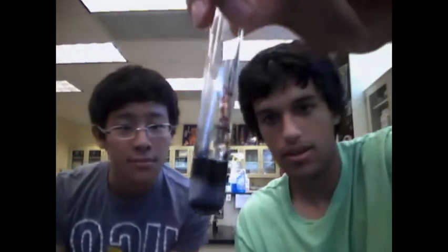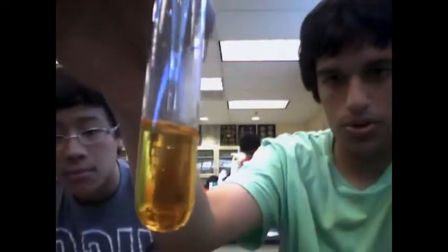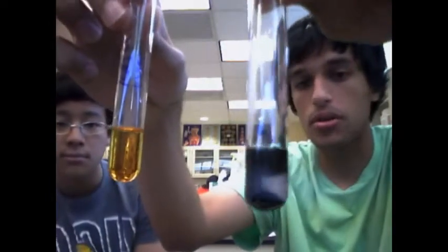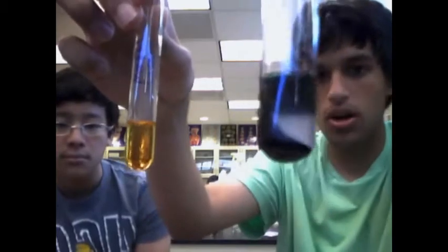Here we have, oh wow, a starch reaction to the Lugol solution. Notice the color change. This is just water, so it's kind of diluted Lugol solution. Notice the color change. This is starch. We know that this is our control. So we can see this is what something with starch would look like when reacting with Lugol solution. It shows that there are complex carbohydrates.